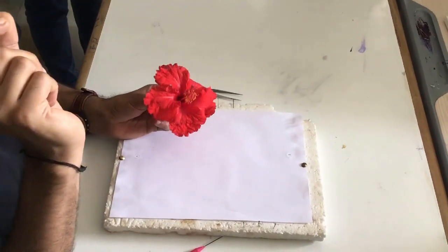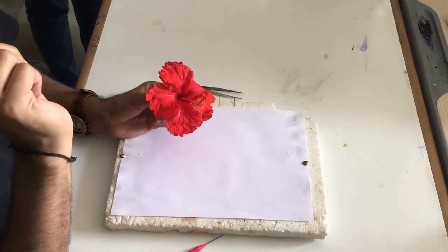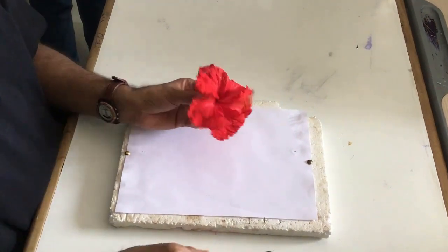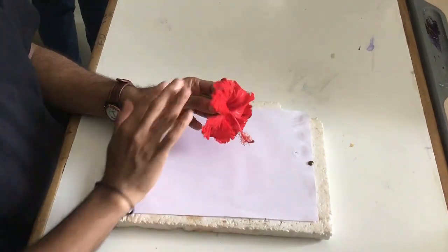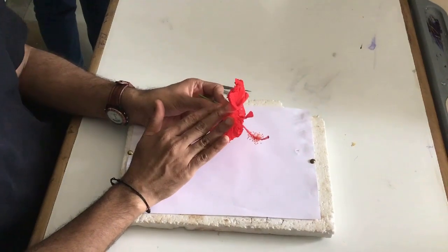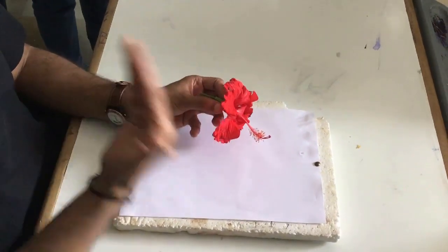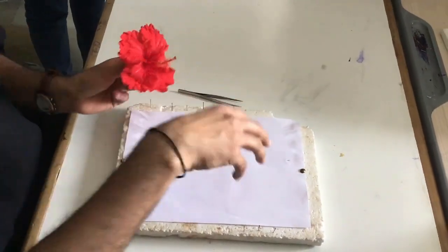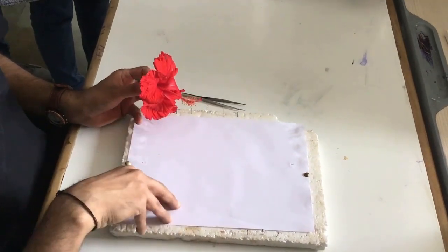This flower is offered to Lord Ganesha — that you already know. Now I will explain the number of whorls this flower has, from outside to inside. Then we will dissect it, put it here, and label it.